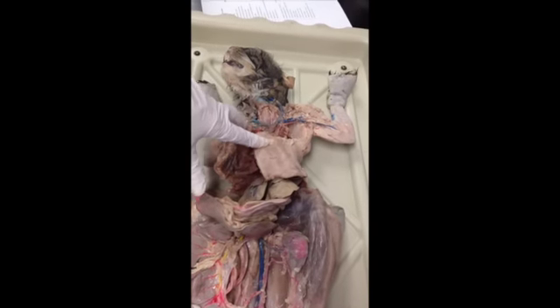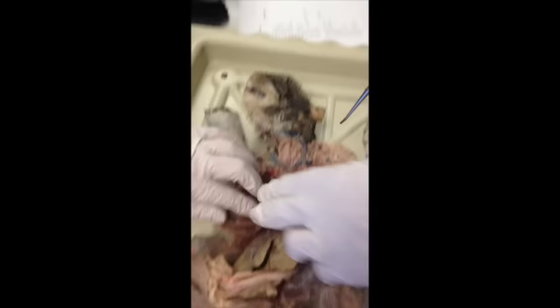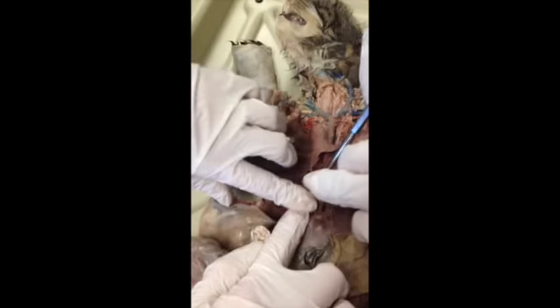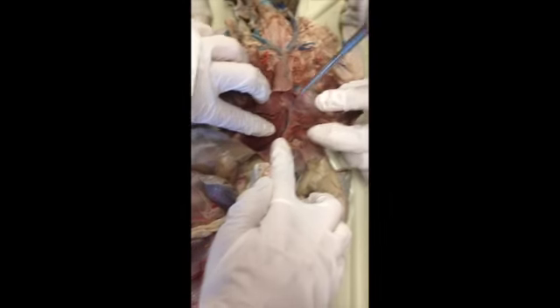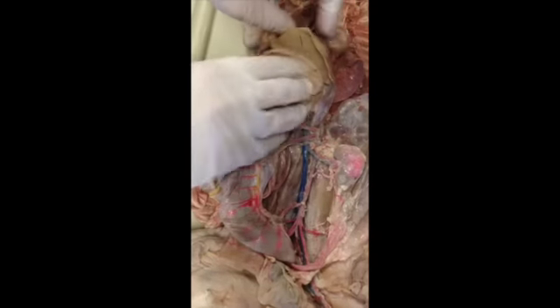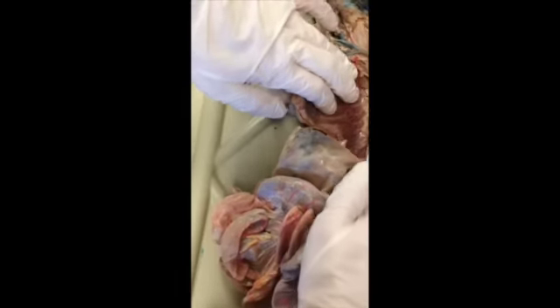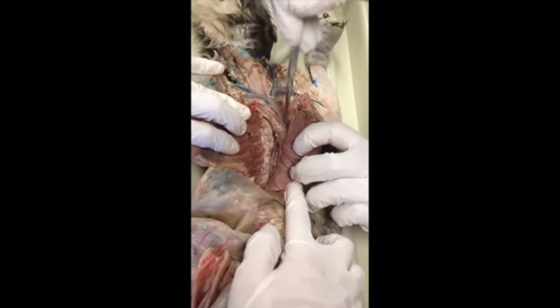Let's see. What else? You said vena cava, hepatic. Okay, so you can see on ours this is part of the inferior vena cava coming out of the heart. And I guess we don't need to know the azygos. Well, we can go back and... If you need to know where it is, the azygos is under here, coming up into the superior vena cava.